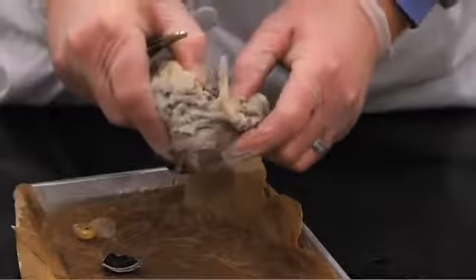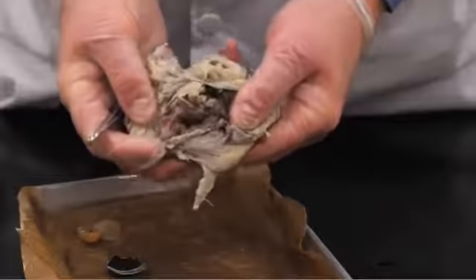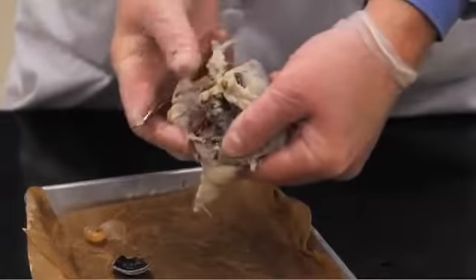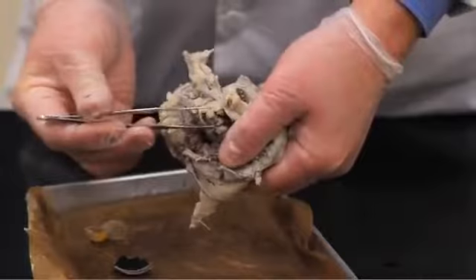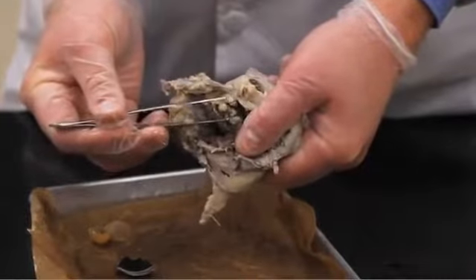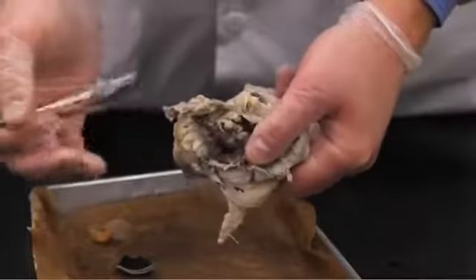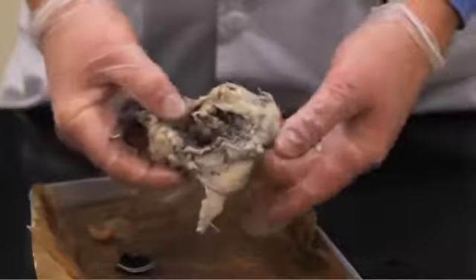The last thing would be that on the posterior portion of the eye, you can see as you pull this apart an optic nerve right there from the side. That structure here is the optic nerve that is the converging point of all of the ganglion layer axons and the pathway of sensory input to the occipital lobe in the posterior part of the brain.